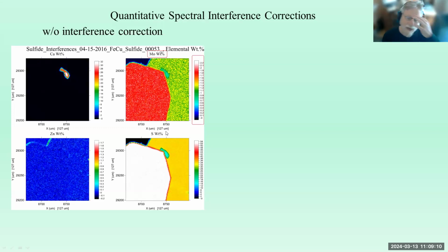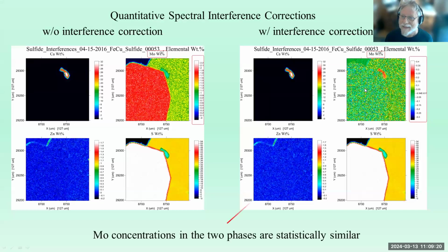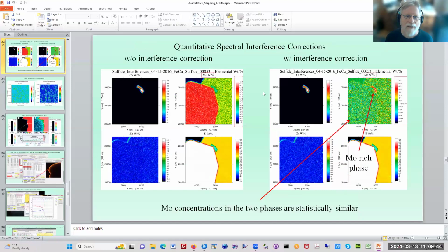But in fact, if we apply the interference correction, you'll actually see that the molybdenum concentrations in both phases are essentially 0. And it's this phase right here that is the molybdenum-rich phase. So you have a complete misapprehension about where the molybdenum is in this material if you didn't do the interference correction. So do the interference correction. And by the way, the interference correction needs to be done as part of the matrix correction. This is why we have that double iteration loop. Very important. And so I'm going to just really quickly demonstrate that for you.